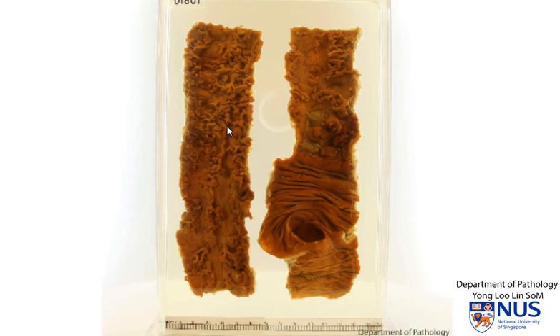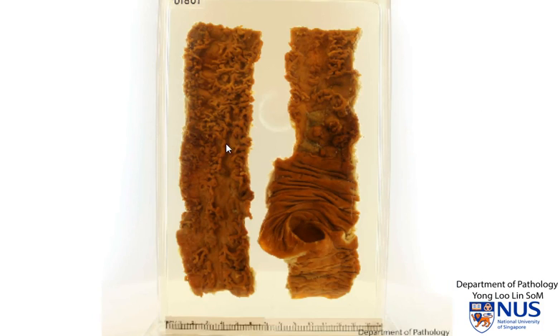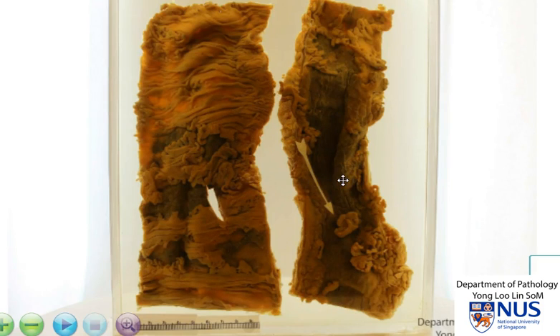Therefore, in summary, here is an example of a specimen of a colon showing very abnormal mucosal features, including longitudinal shallow ulcers and numerous pseudopolyps due to mucosal regeneration in the intervening mucosa. Similarly, in this case, we can see that the ulcers are fairly shallow and there's abnormal intervening hyperplastic regenerative mucosa in these regions, and also we can see the pseudopolyps here.